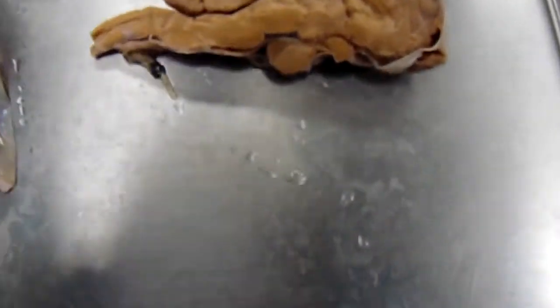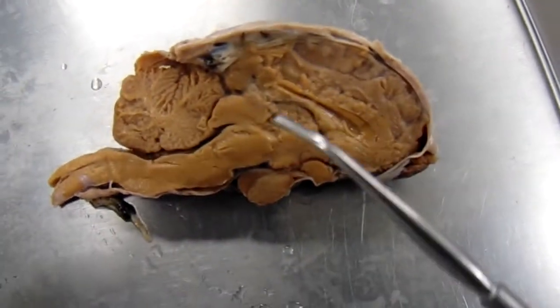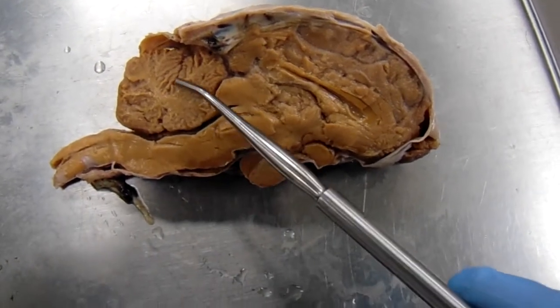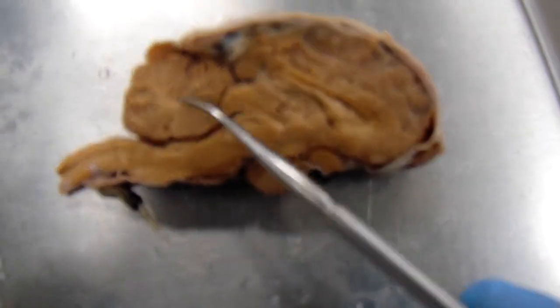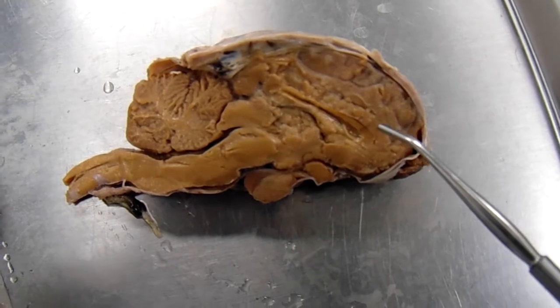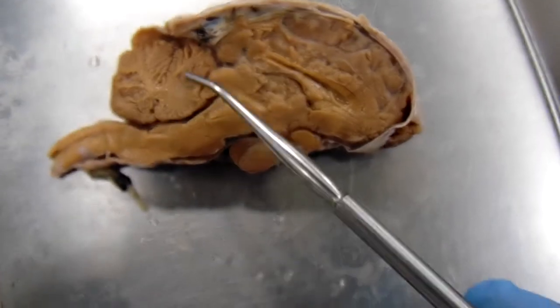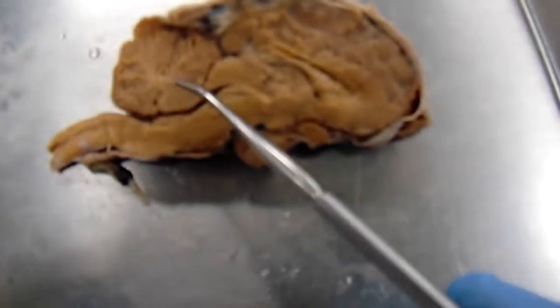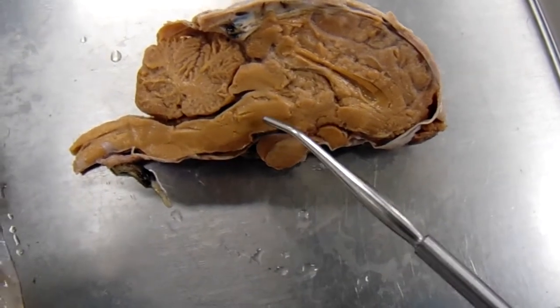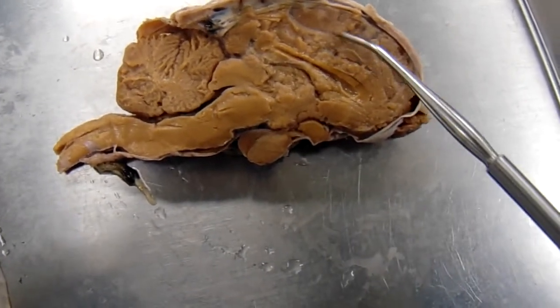Here is the sagittal cut. So that would be the cerebellum there, and all of this is the cerebrum. So the three regions of the sheep brain, or any brain: cerebellum, brain stem, and cerebrum.